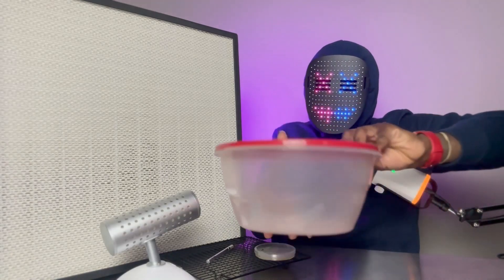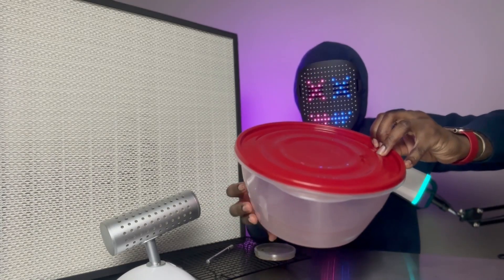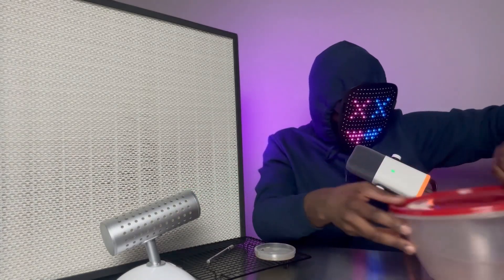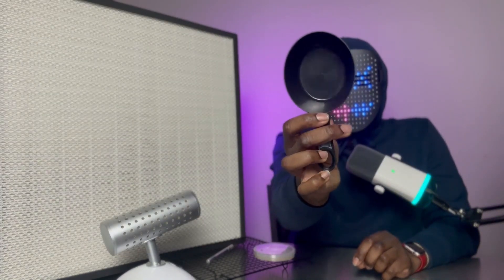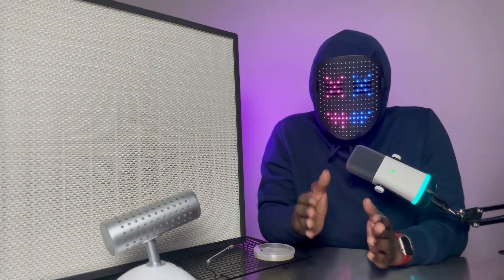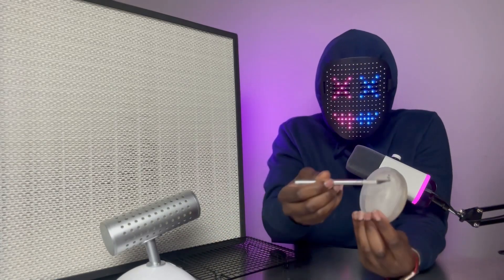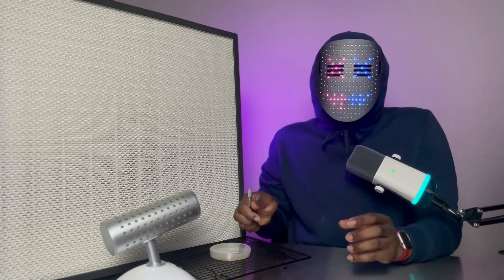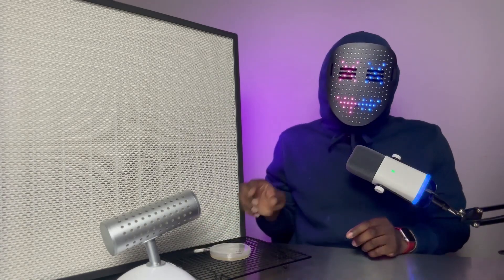You're also going to need large Tupperware bowls like this — you can get these for about $2 a piece at your local grocery store. You're also going to need a one-cup scooper like I have right here. The goal is to prepare our grains, go through the whole process of pressure cooking and sterilizing them, and then cutting up little pieces of our myceliated agar or mycelium and inserting it inside our jars with our grain. If you're ready and have your materials, let's go down to the kitchen.